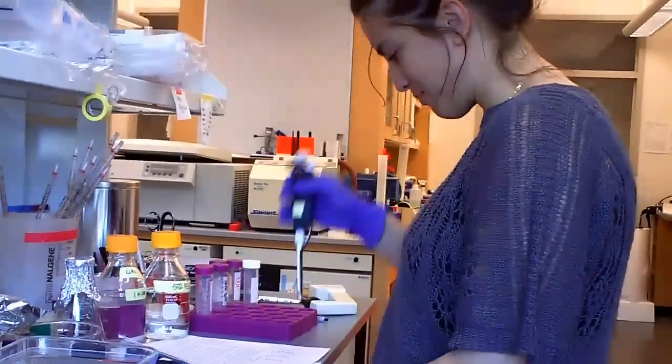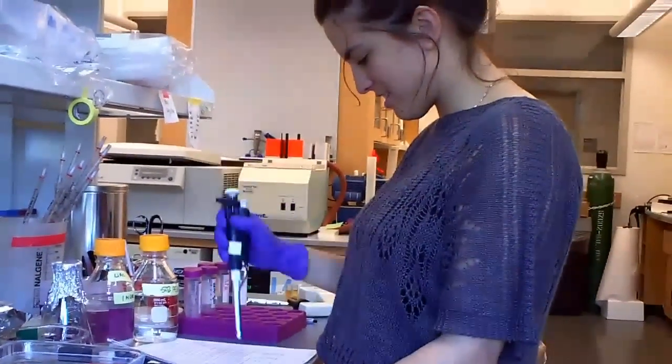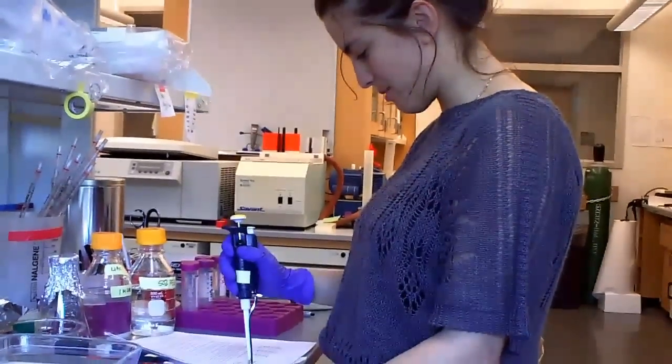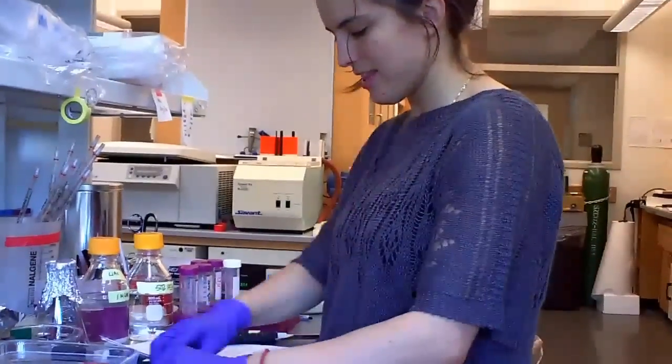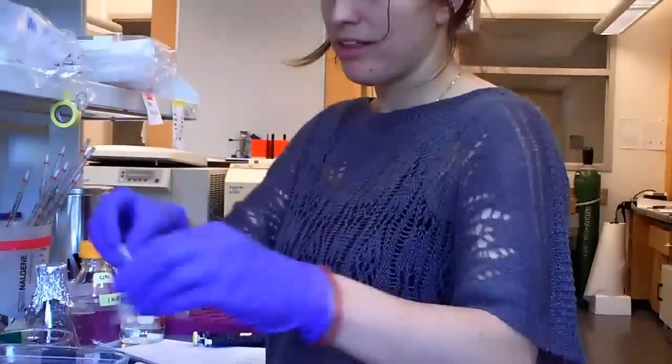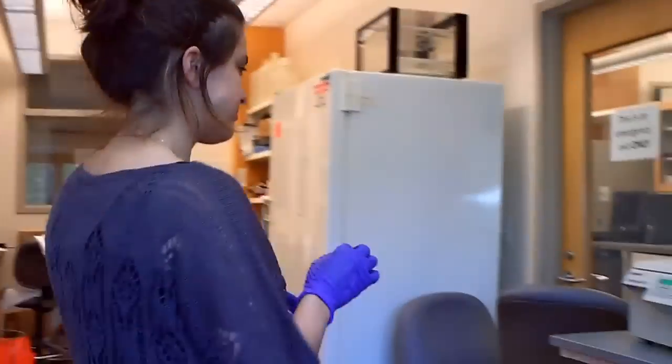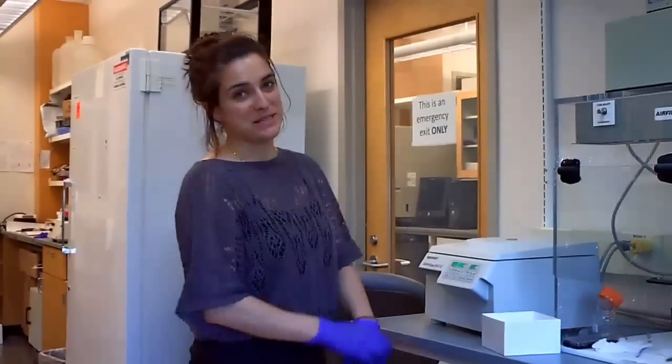Okay, so we have the PEG, lithium acetate, boiled salmon sperm, plasmid DNA plus water, and then coming up we have cells. Perfect timing.